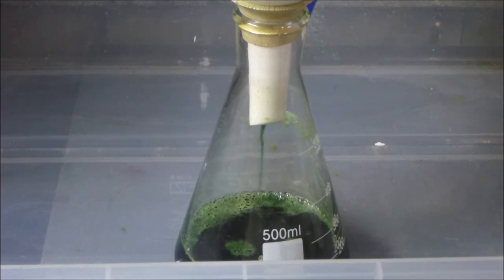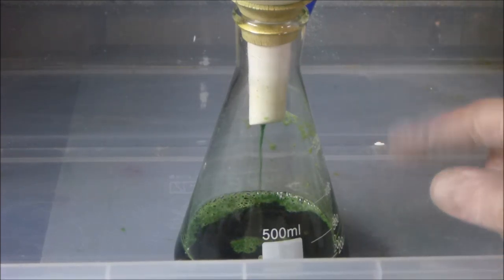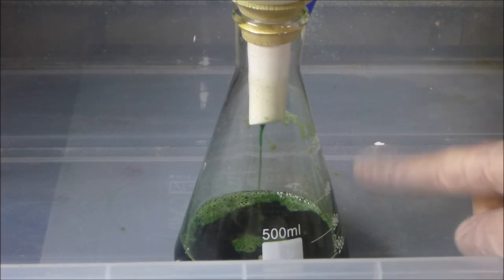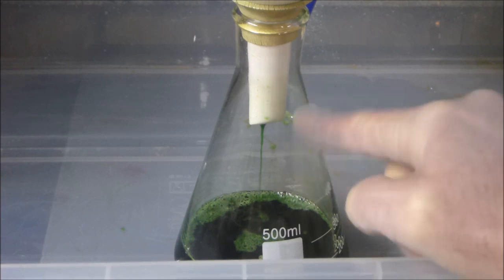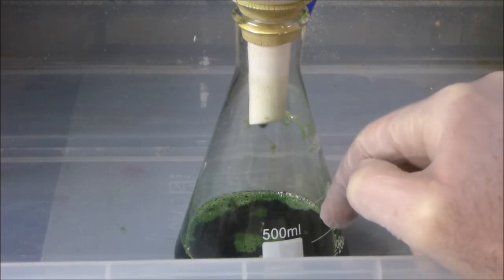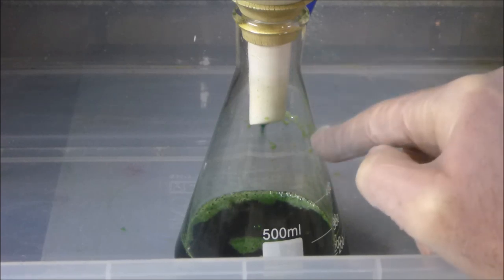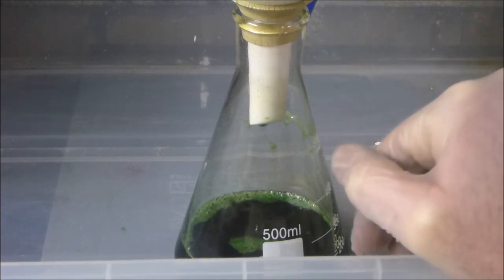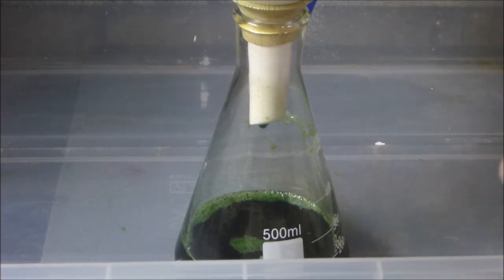Okay guys, so I'm just getting to the end of my 4 liters or so of AP that I started with, and as you can see at the end we're still getting a very decent stream. So the total time to filter that 4 liters of acid peroxide was about 40 minutes or so, which is absolutely incredible. That's the fastest by far that I've ever filtered that much of a solution.